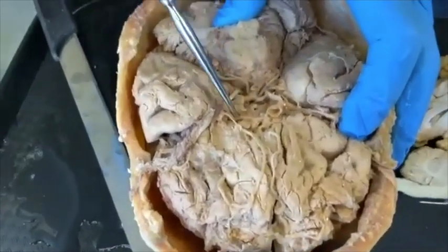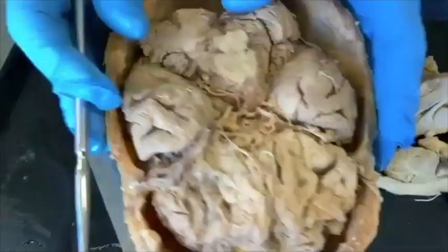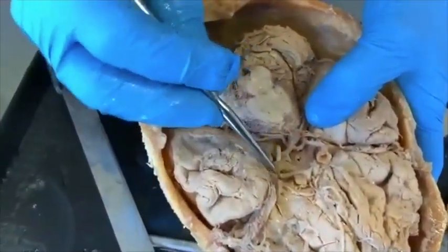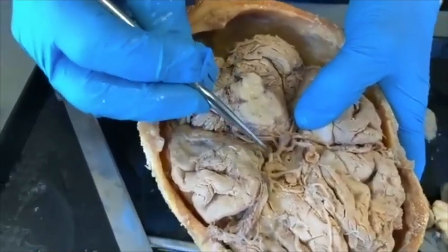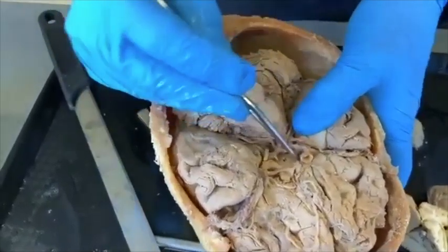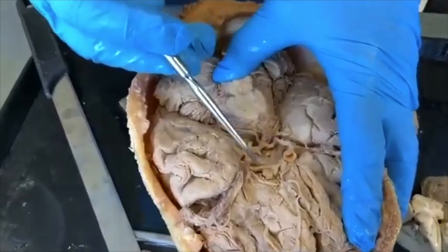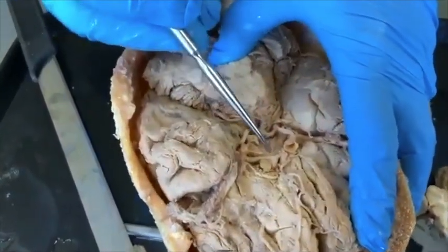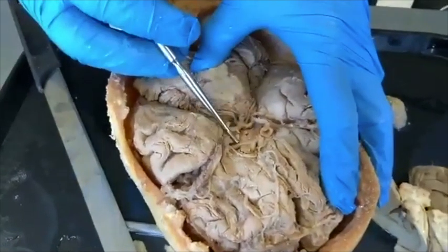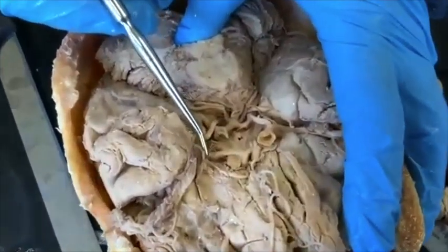Here are the internal carotids coming in at the bottom of the brain. The internal carotids bifurcate and connect to form a circle — and this is called the circle of Willis. It's the only place in the human body where there is a circle of vessels. The bottom line is that if you cut off one carotid, the other can serve the rest of the brain. It's not going to do a fantastic job, but it'll keep you alive and conscious.